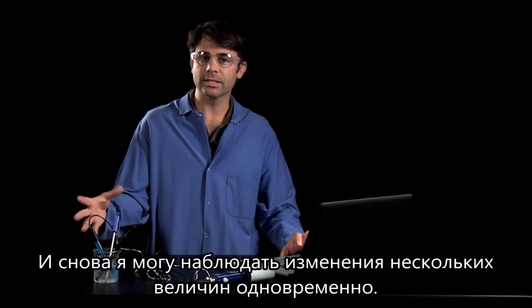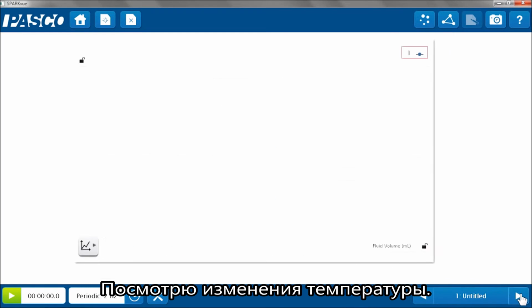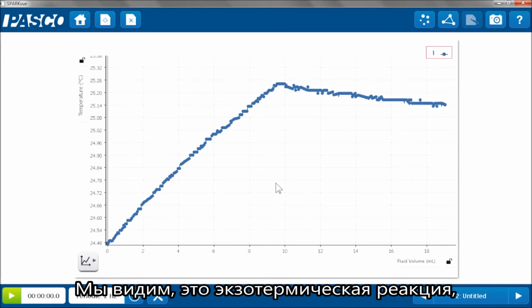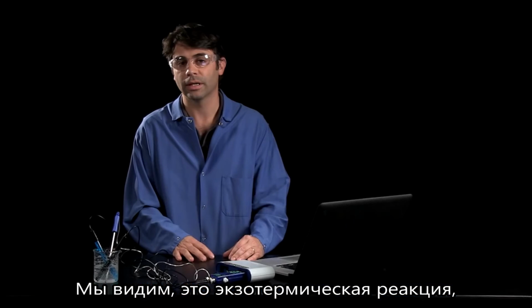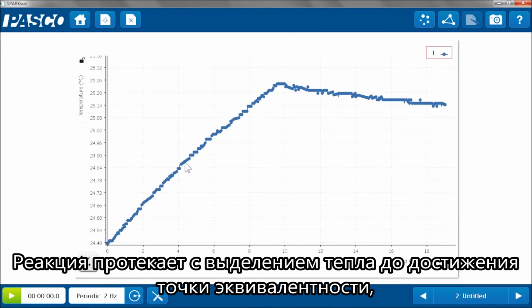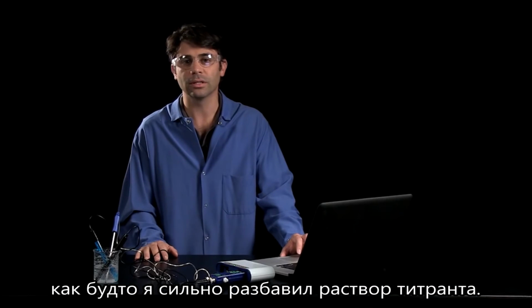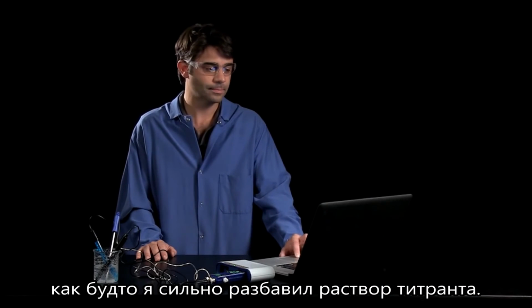But again, the interesting thing is I can look at lots of other stuff at the same time. So I can look at the temperature. Now we can see, oh, this is an exothermic reaction, and can tie in thermochemistry and acids and bases. The reaction kept heating up, giving off heat, until the equivalence point was reached, and then the temperature started to go back down as I was essentially just diluting the titrant that I added.